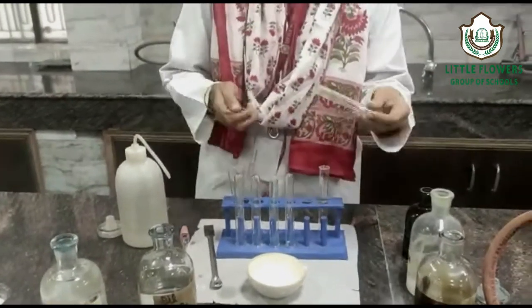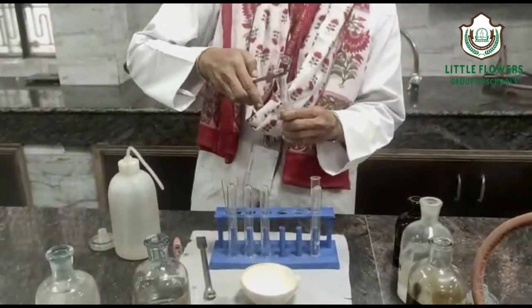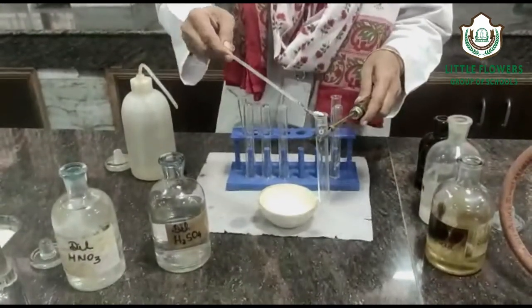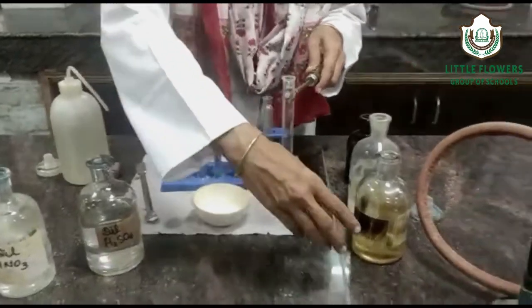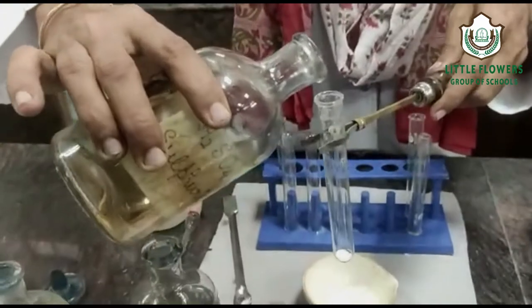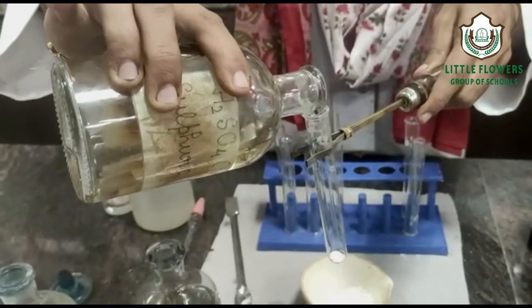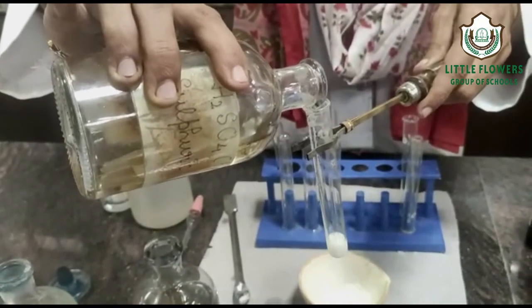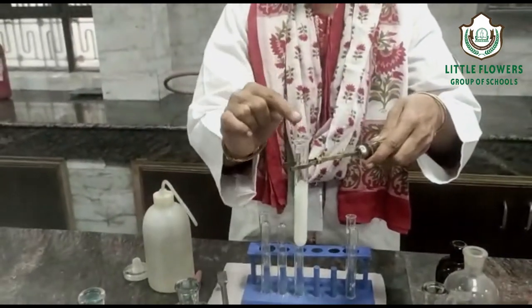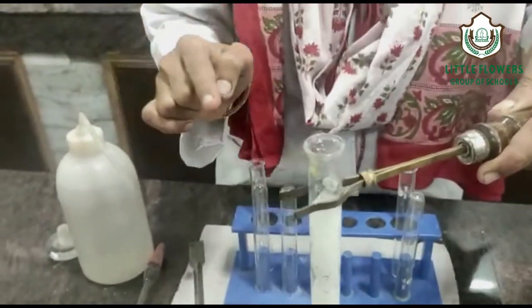For that, in a fresh test tube we take the salt and add concentrated sulphuric acid. Observe carefully — there is a reaction. You can see a colourless gas is coming out.